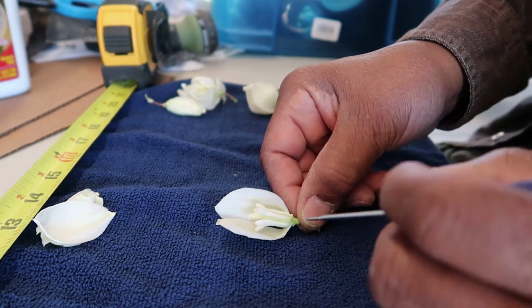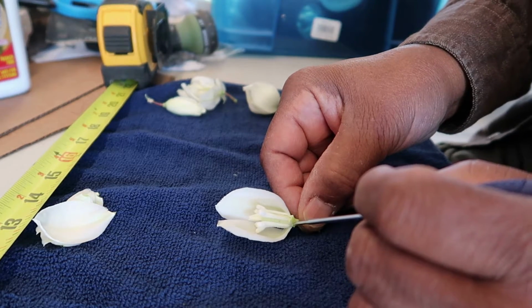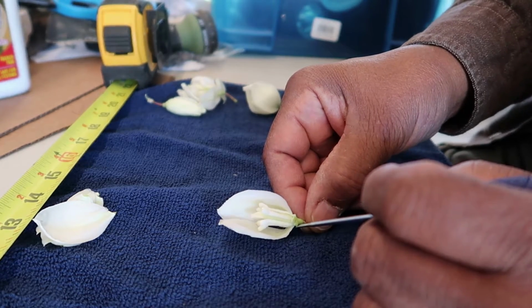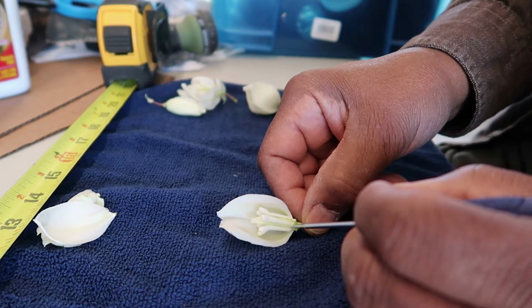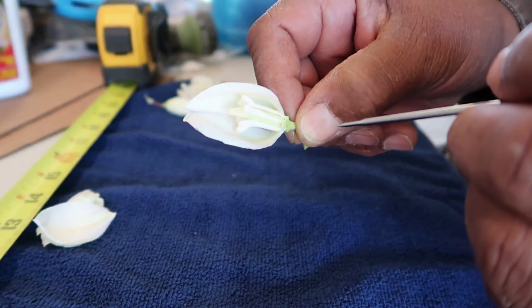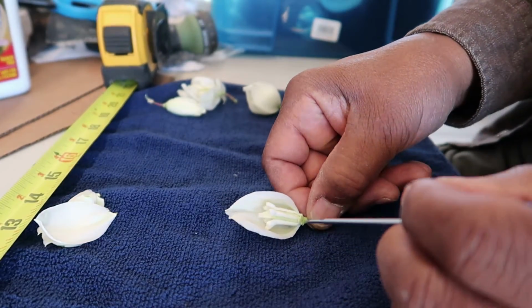Immediately recognizable. Again, this is where the sepals and the petals join at the base in this receptacle area. And also the stamen come all the way down, as you can see here. Hopefully you can see that, to this base area as well.